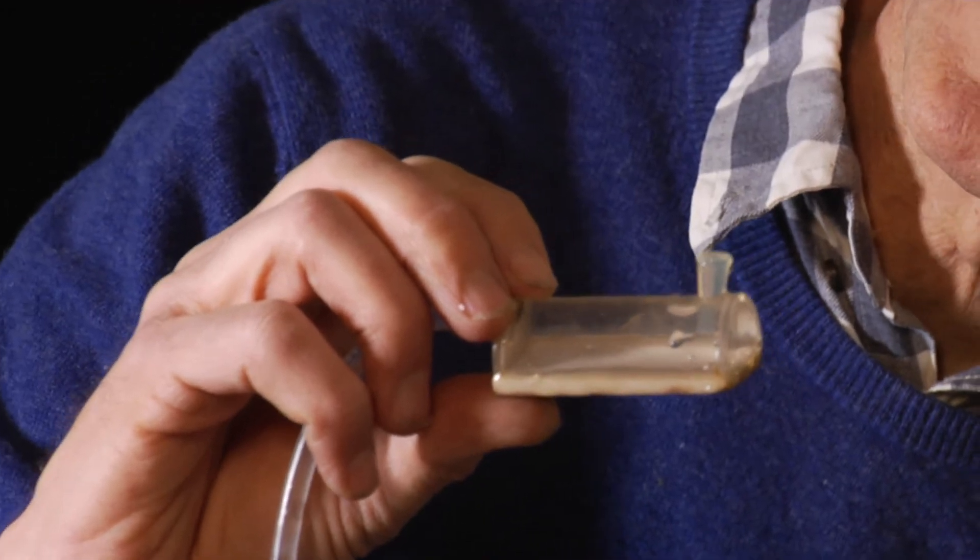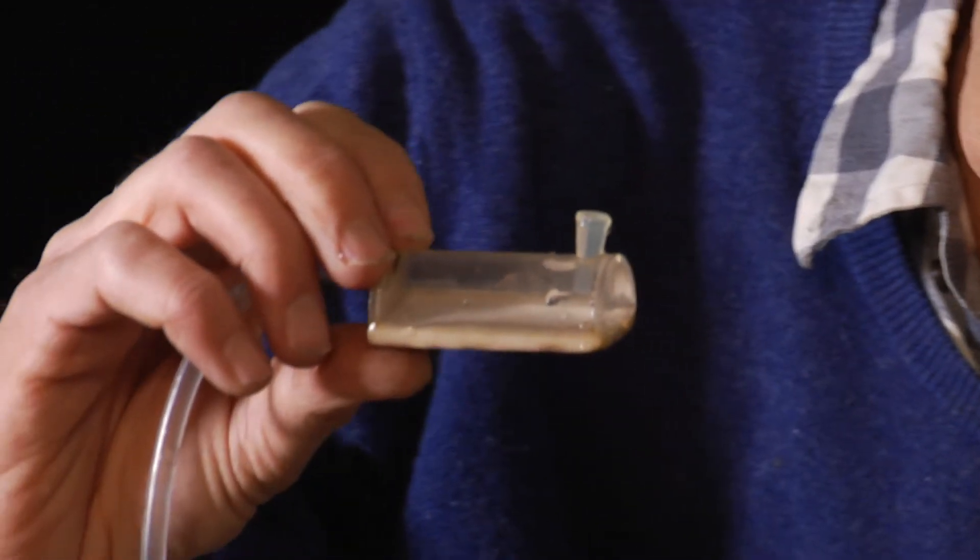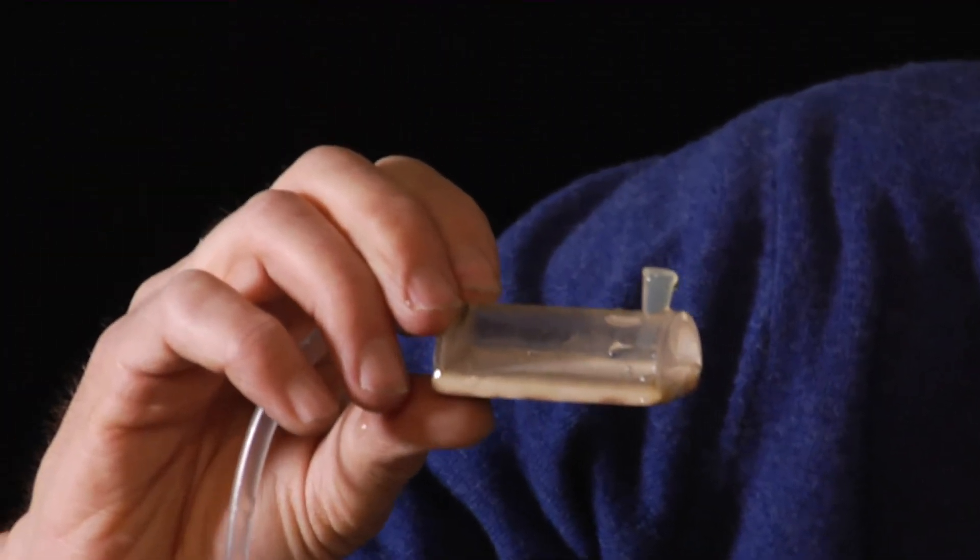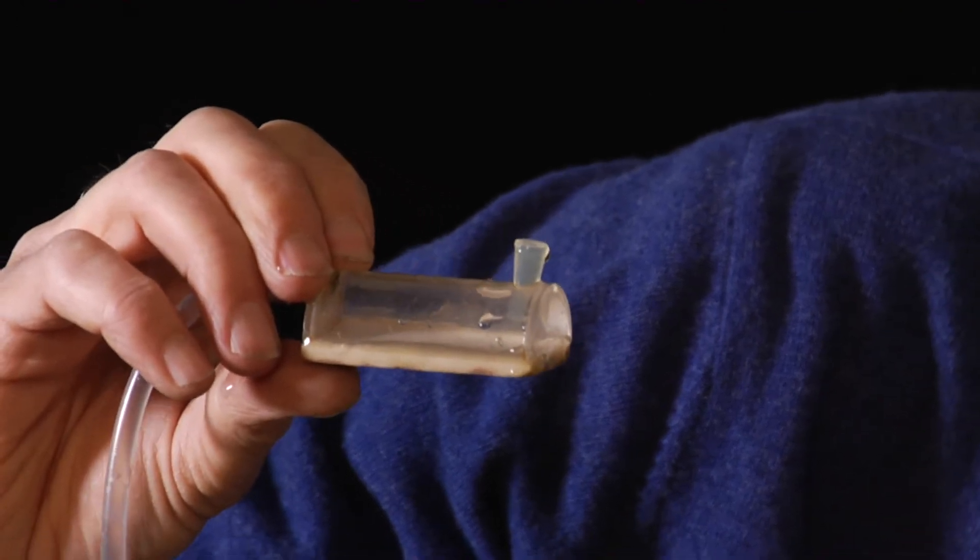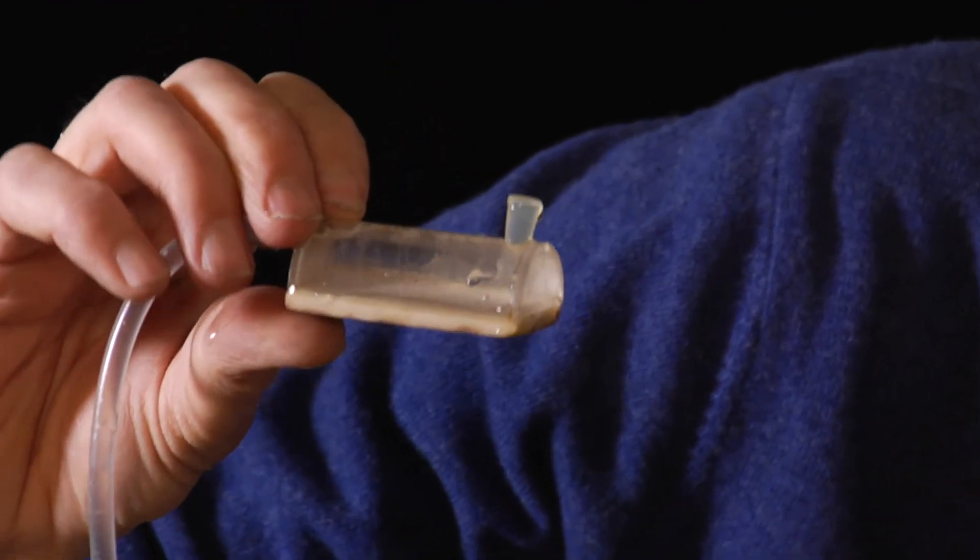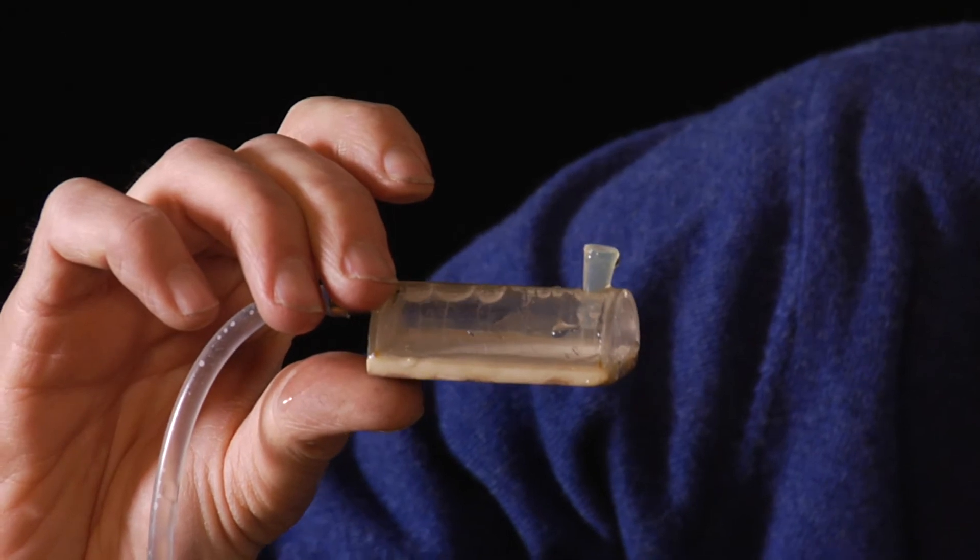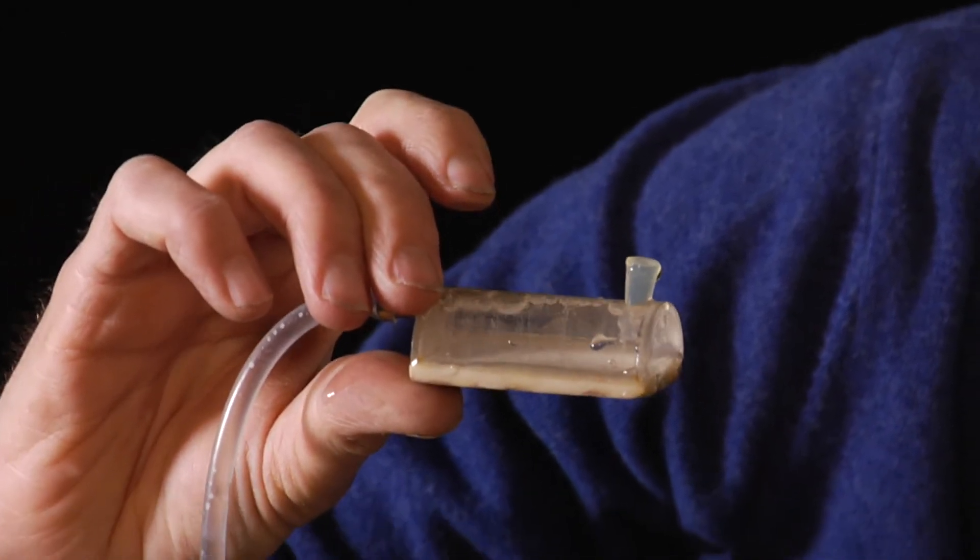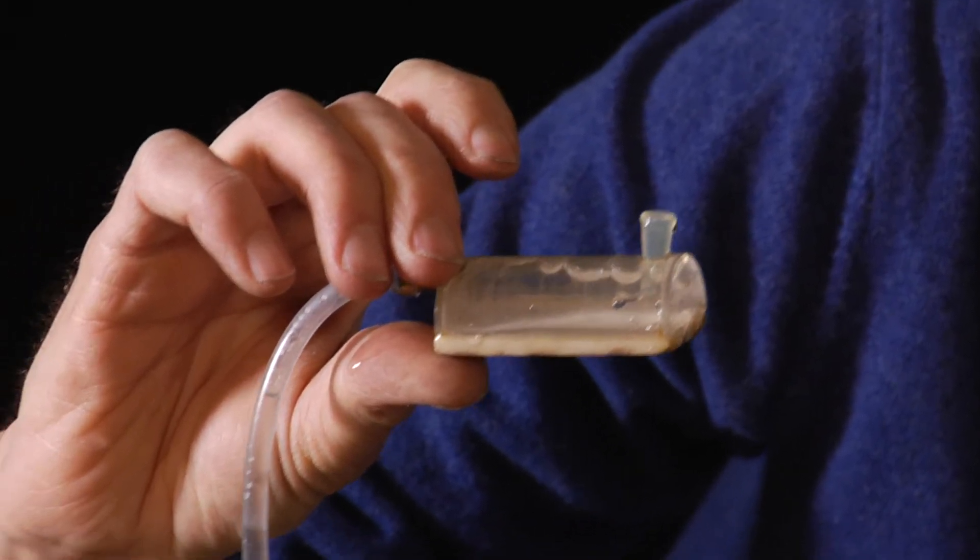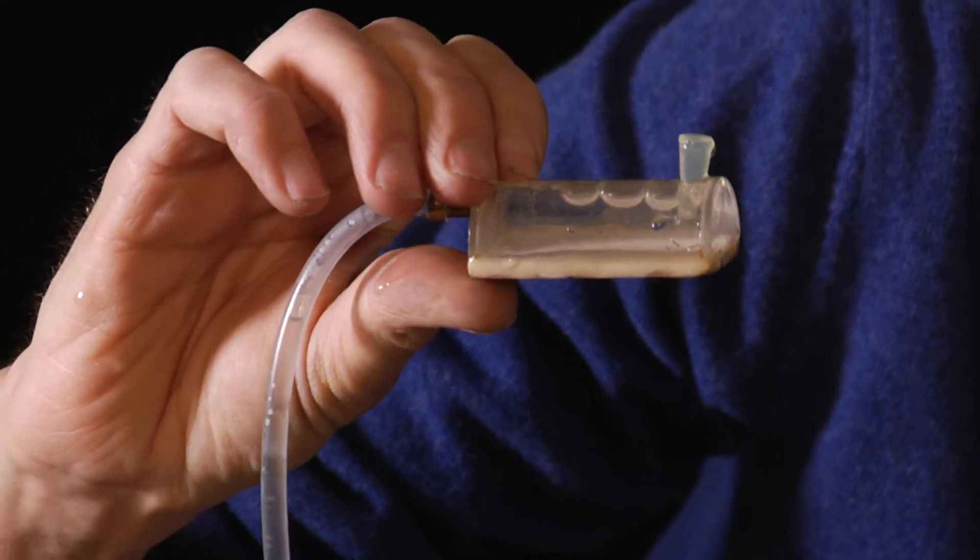If I continue lowering the end of the tube, you will soon see that air enters the pores. Now air starts to enter the pores and water drips from the tube. If I lift the tube, the dripping and air bubbles stop.